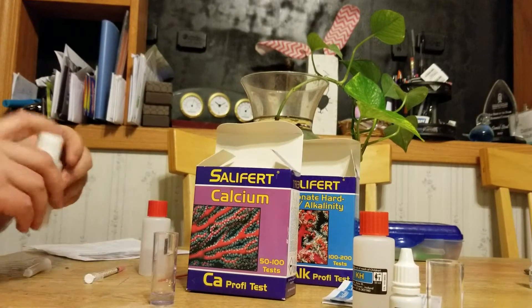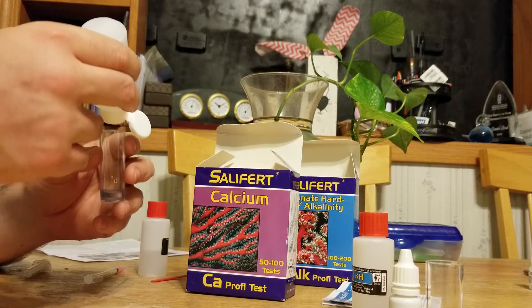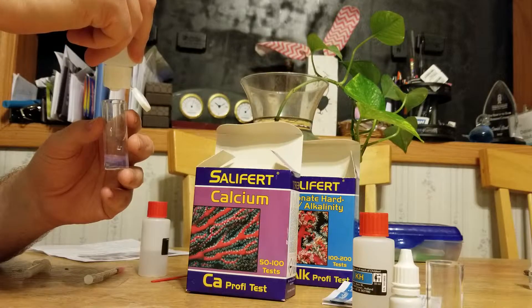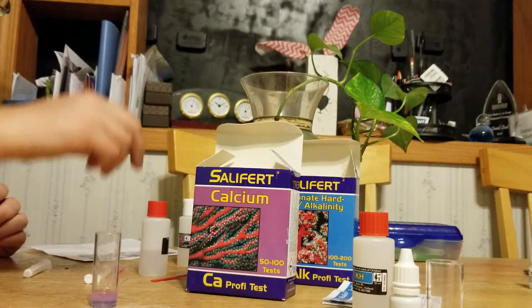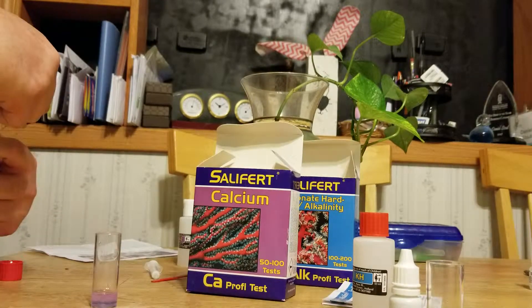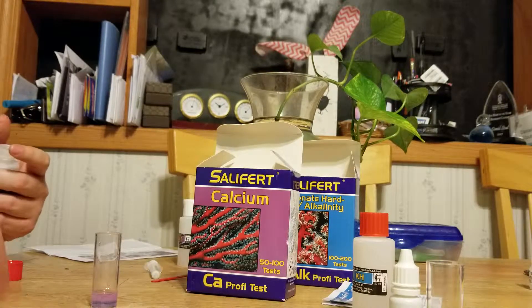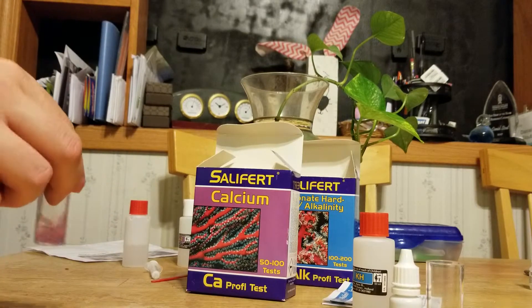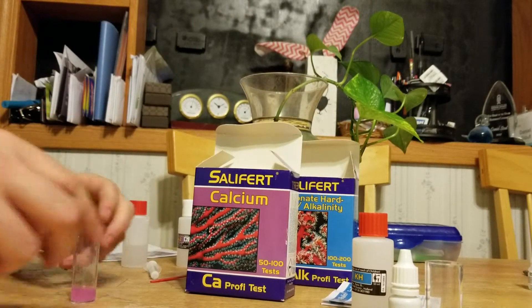One scoop of solution A — it looks like purple sugar or salt. Then ten drops of solution B. I always notice right when I first dump it I get one drop already, so I watch carefully: one, two, three, four, five, six, seven, eight, nine, ten. The bottle is quite hard to squeeze — I'm always concerned I'll squeeze out too much. Now with the pipette, get solution three, fill it all the way up to the one milliliter mark on the plunger.